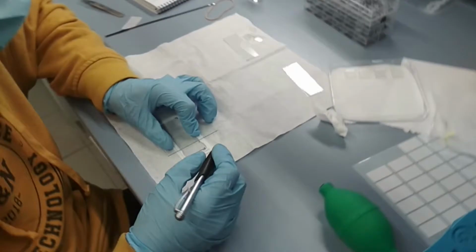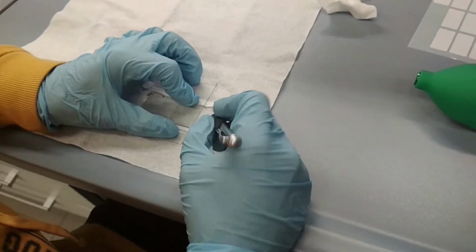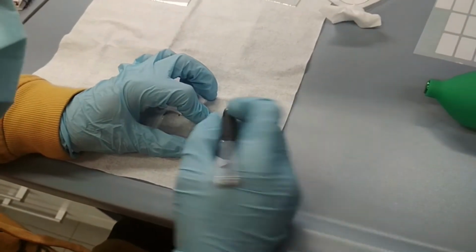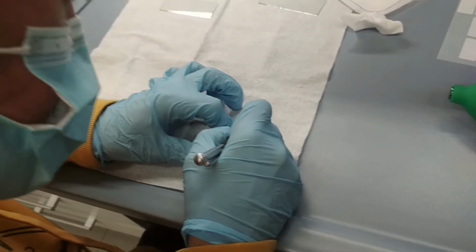So here we are cutting some glasses. I have a template, and with a kind of diamond tip, I mark it.